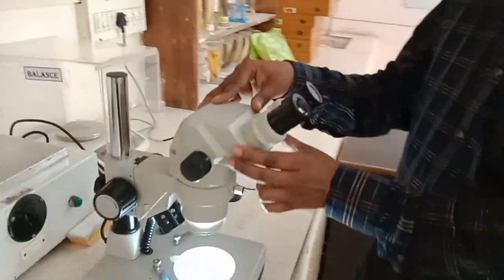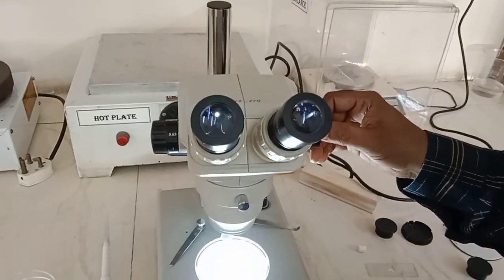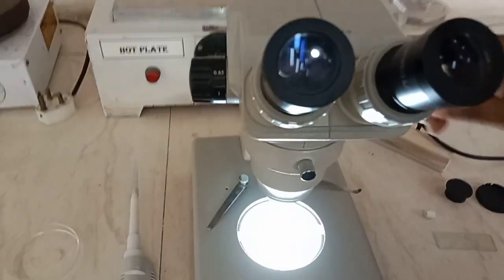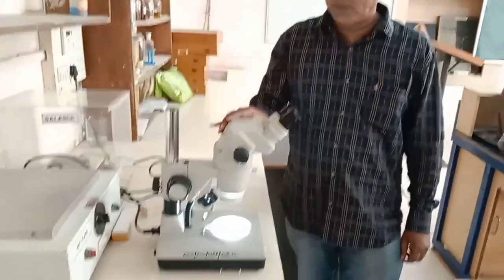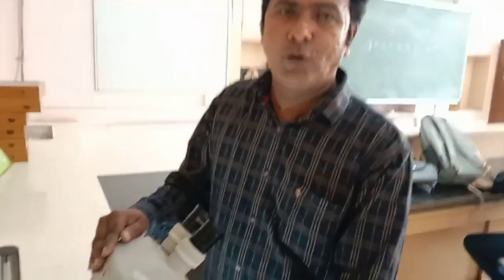This stereo microscope is used for observation of some insects, smallest metazoans like helminth parasites, as well as plant and soil nematodes. This is an Olympus Magnus microscope. The magnification is very high and we can clearly see the nematodes or soil nematodes under the magnification of this microscope.